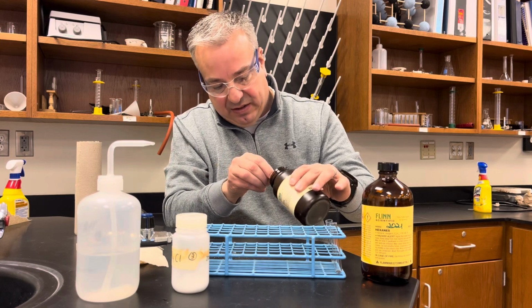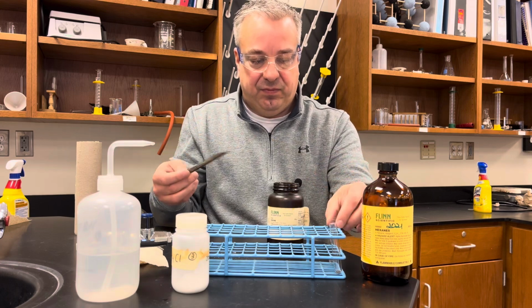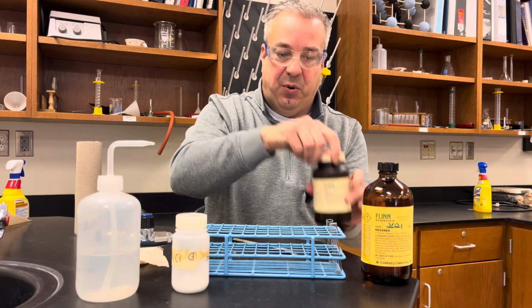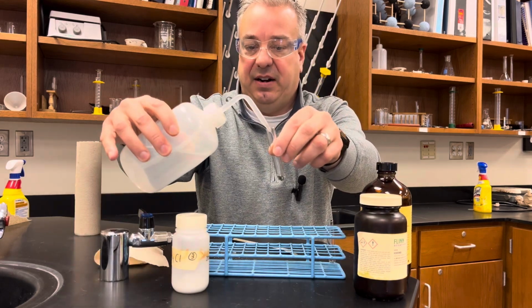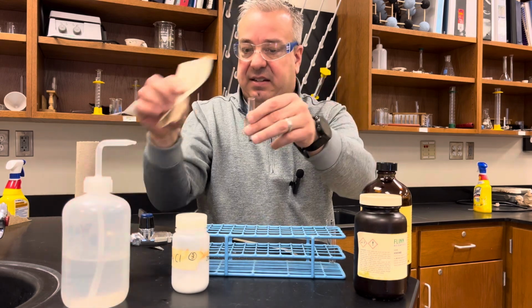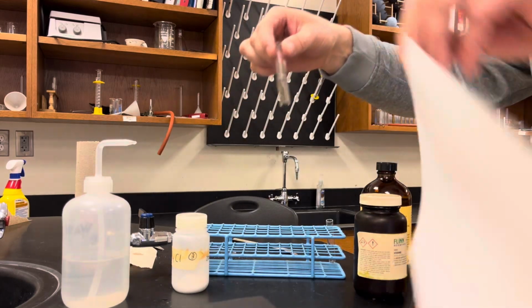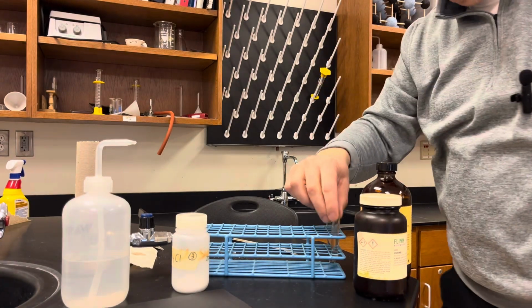I don't have a whole lot of this stuff. And we're going to do the same thing. We're going to put water in this test tube first. We're going to put some water in there, and it does not look like it's going to dissolve. I will shake it up. Now the iodine is dark, so I'm going to use a white background to show that it still is in there. You can still see the iodine at the very bottom of this test tube. So the iodine that is nonpolar will not dissolve in the polar solvent, water.